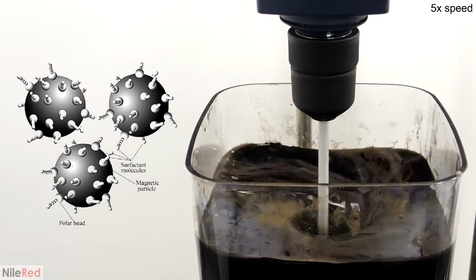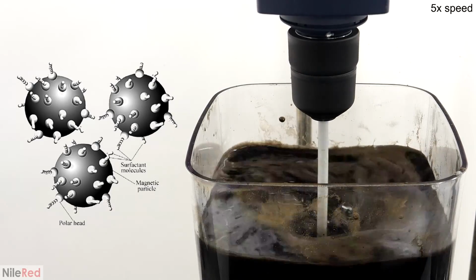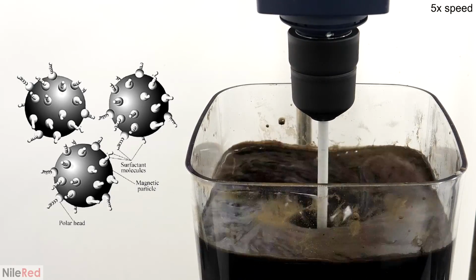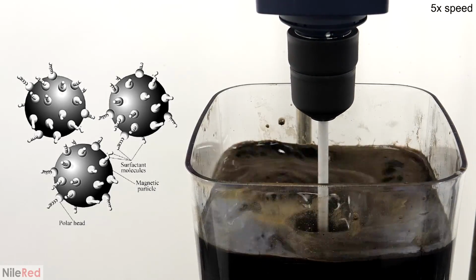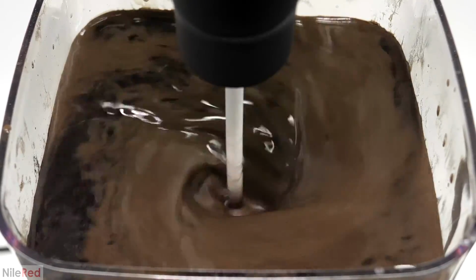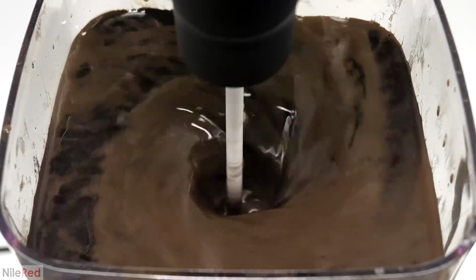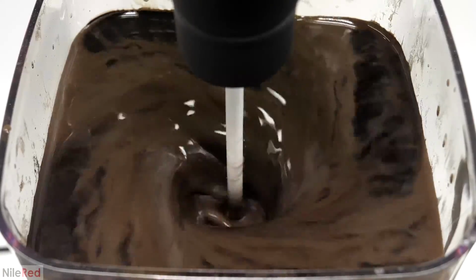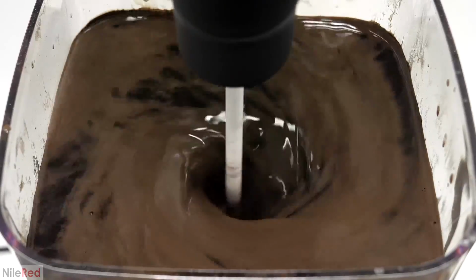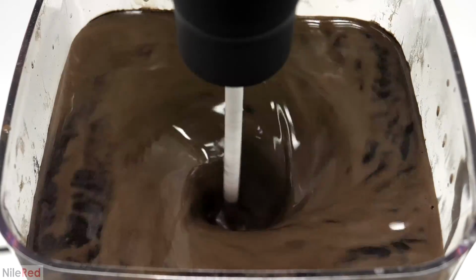One of the biggest issues with magnetite nanoparticles is that they tend to want to aggregate together and to stop being nanoparticles. With the ammonium oleate on their surface though, and with all these tails sticking out, the particles are stabilized because they're physically being blocked from coming together. On the surface, I started seeing a lot of brown stuff, which can be a bit scary because it might indicate some unwanted oxidation. I think it was mostly just soapy foam though that was filled with extremely small particles of magnetite. I of course could be wrong about that and it could be because of oxidation, but I just don't think that's the case.